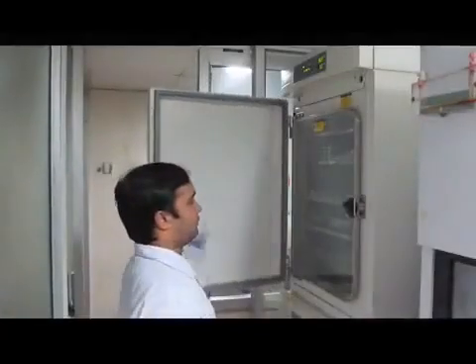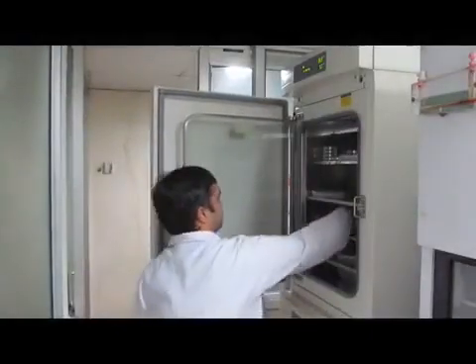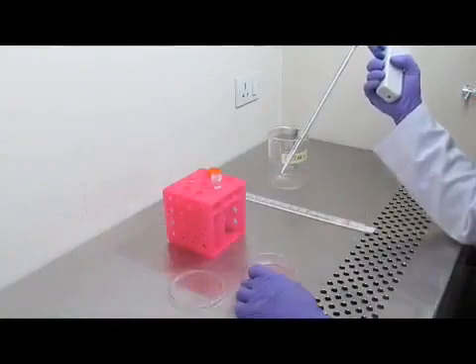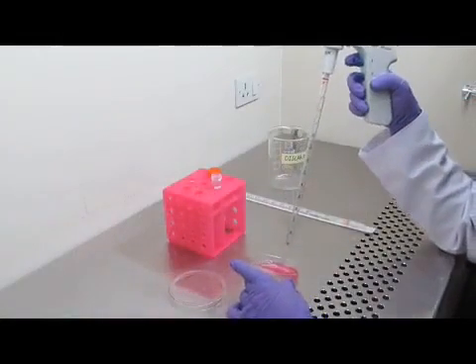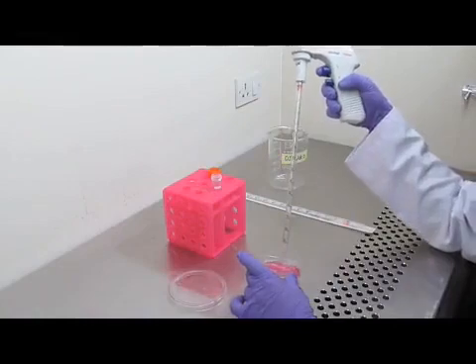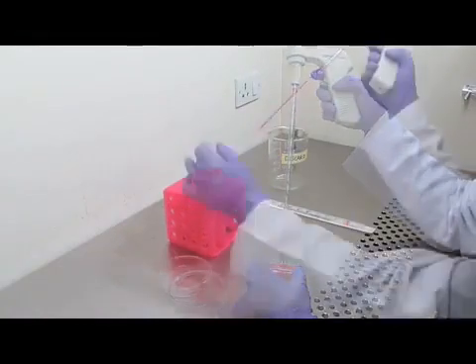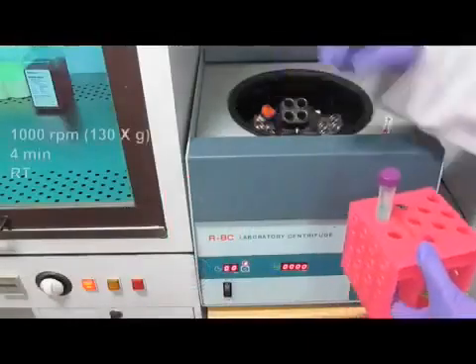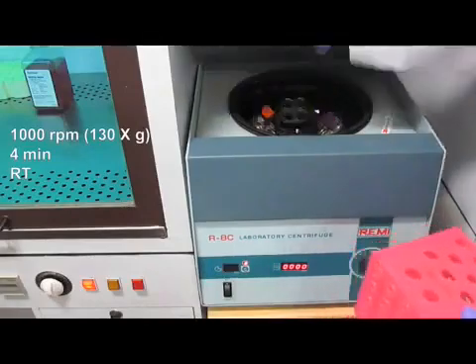To begin the procedure, two days prior to infection, grow THP1 monocytic cells to 80% confluency. On day one, take out the culture dish and swirl gently to bring all settled cells into suspension. Transfer the THP1 monocyte cell suspension into a 15 ml centrifuge tube and centrifuge at room temperature for 4 minutes at 1000 rpm.